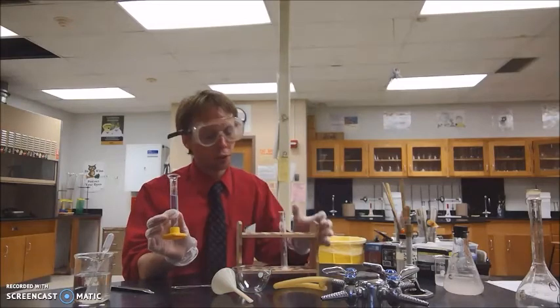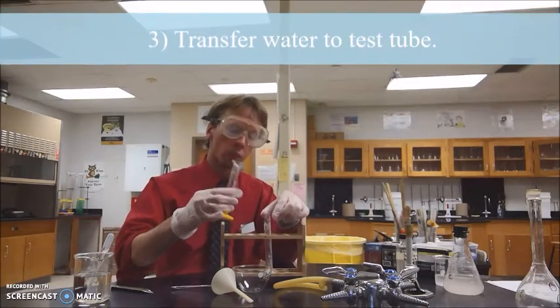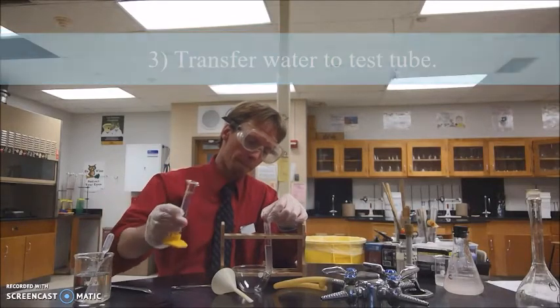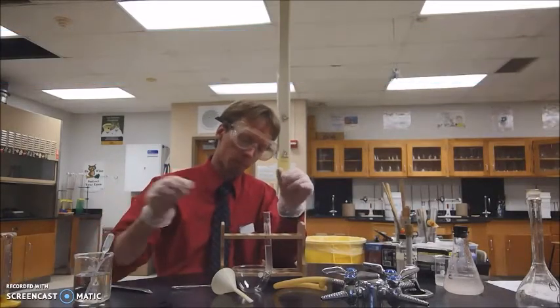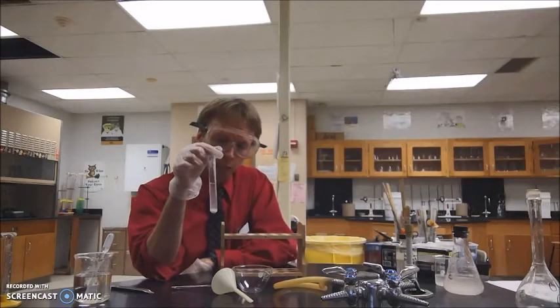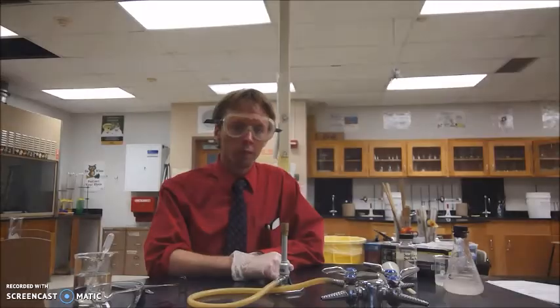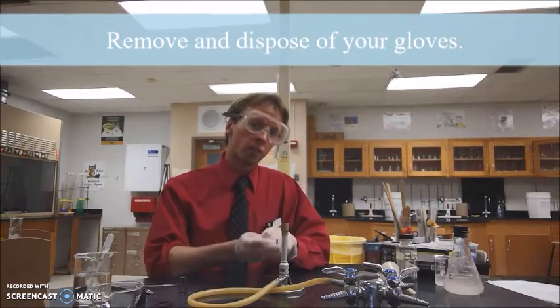Next, what you'll do is you'll carefully transfer the water to the test tube. And now you have a mixture of water and sodium sulfate. You're no longer working with solid sodium sulfate, so you can take your gloves off at this point.